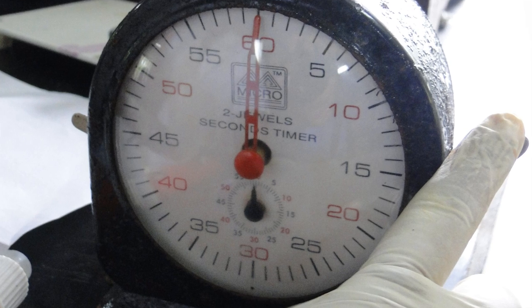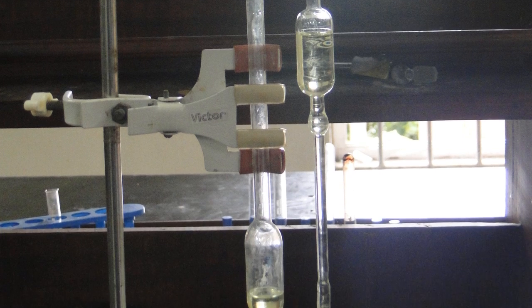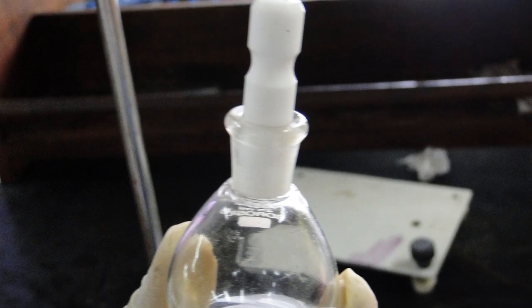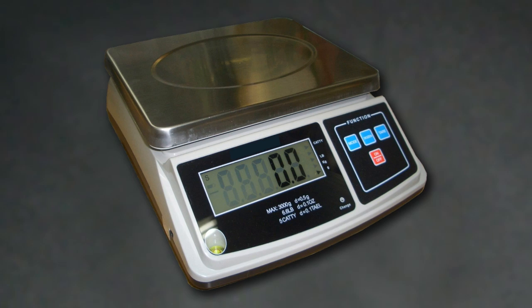Now the apparatus used: wash bottle, stopwatch, Ostwald's Viscometer, unknown liquid, pycnometer or RD bottle, pipette, and weighing balance.